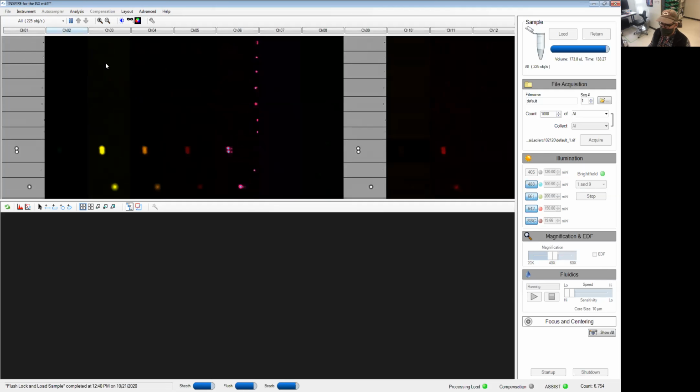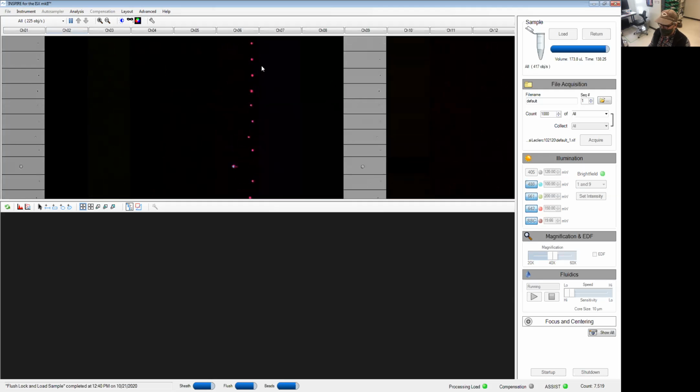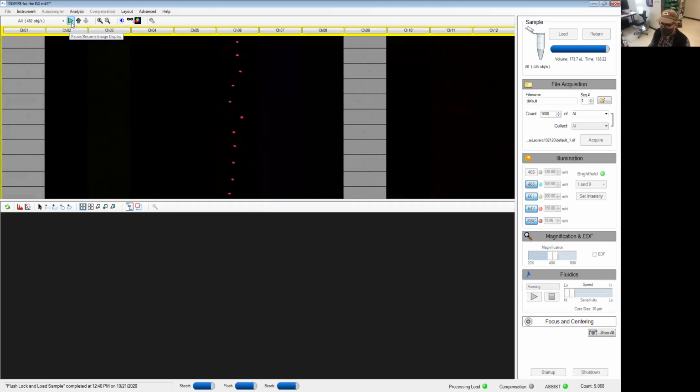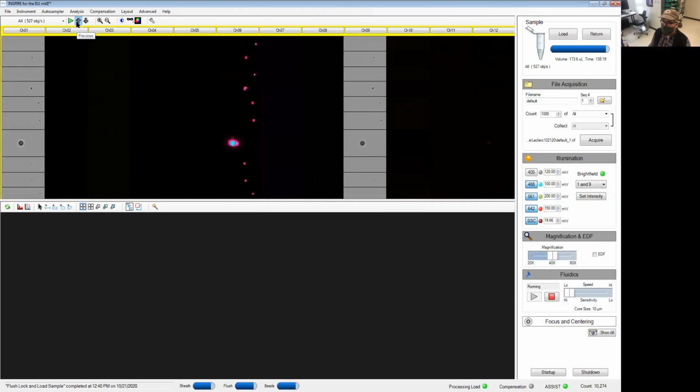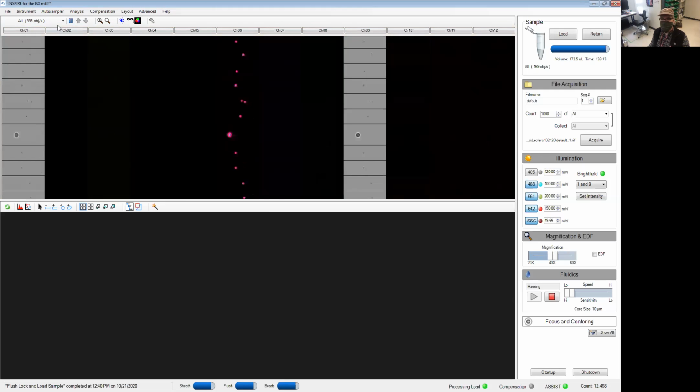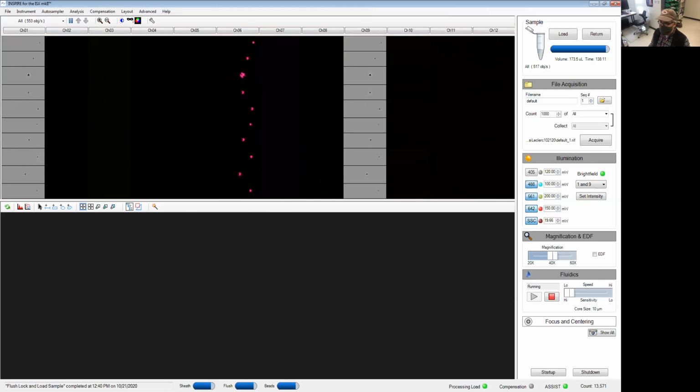So the first one would be if you want to stop the display, maybe you saw something that was fun, you can press the pause button and then scroll back up to see specific events that strike your fancy. It doesn't stop the actual acquisition, it just stops the display on this window.